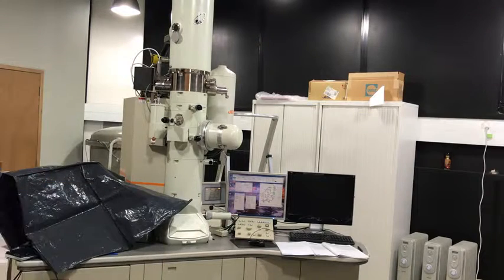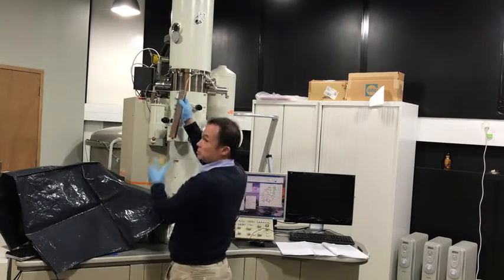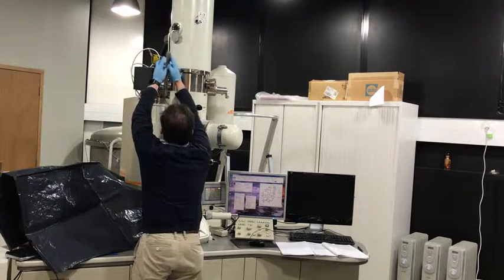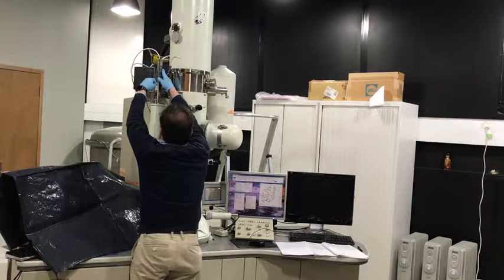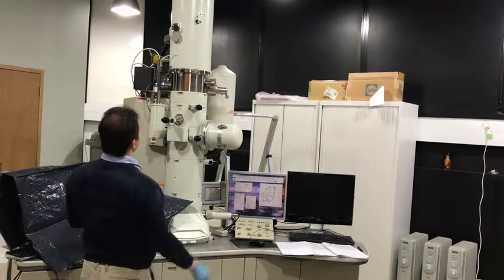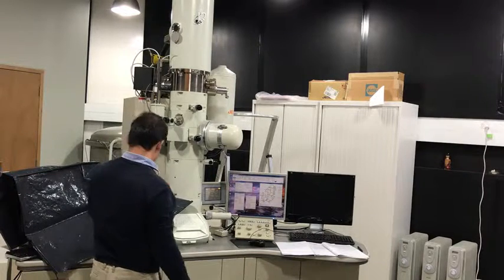So now I've got to switch the ion gauge off. And I put this wacko looking device into the dewar, and this usually produces quite a plume of liquid nitrogen. So here we go. Oh my goodness. It's going. Okay, so there's a nice little fountain of liquid nitrogen going out there. A few little spits.